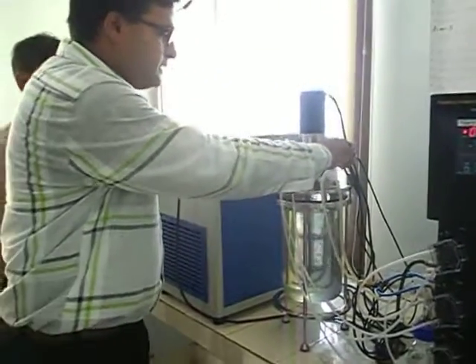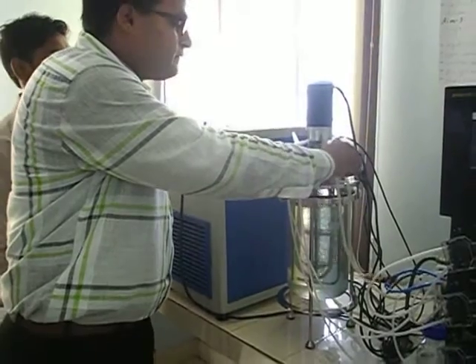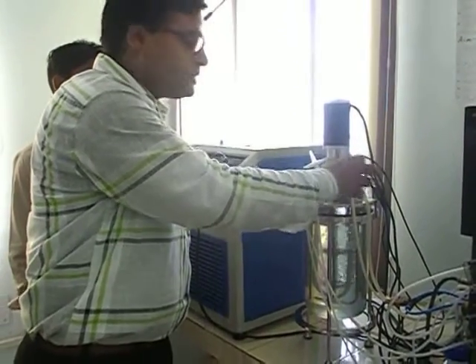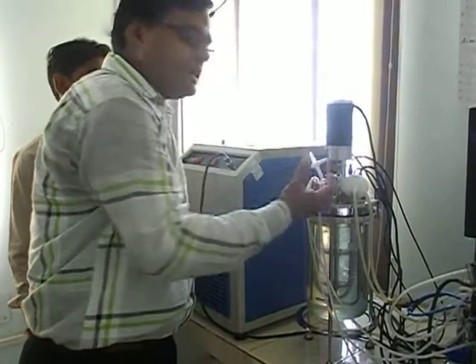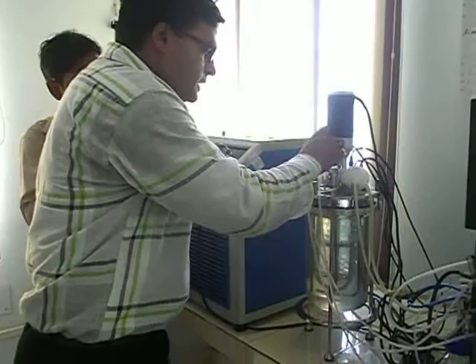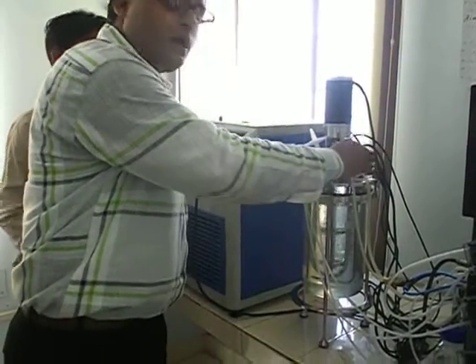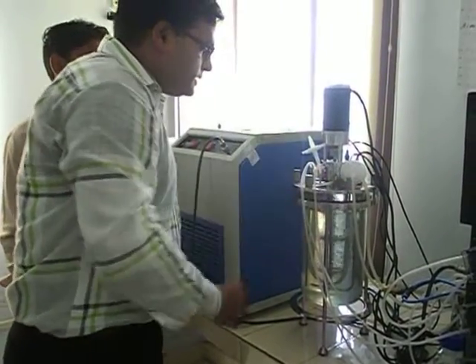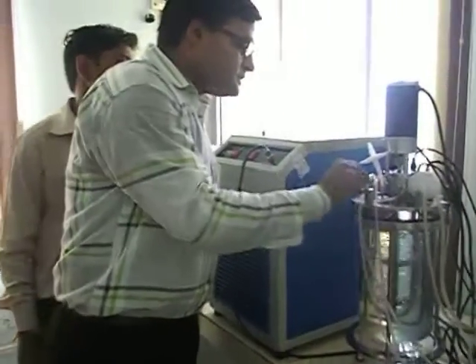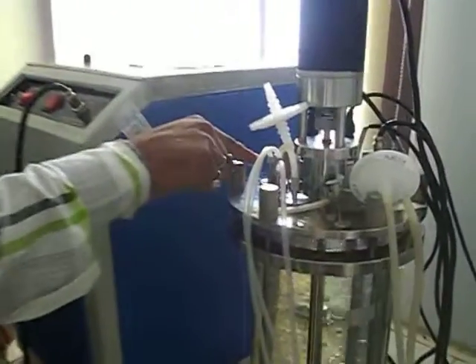This is a 0.2 micron filter — a size 50 filter for air sterilization. This is the air in and the air out.